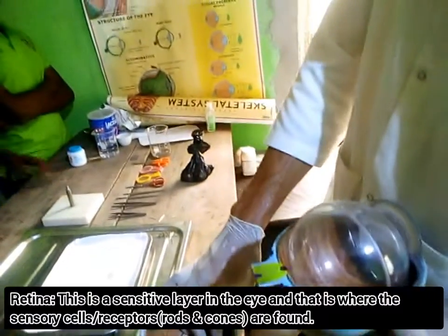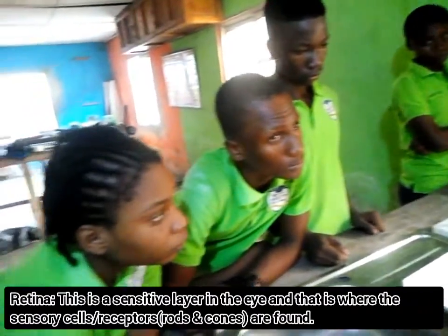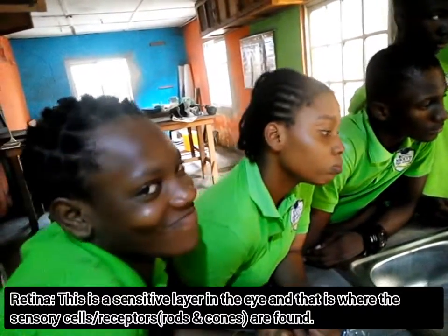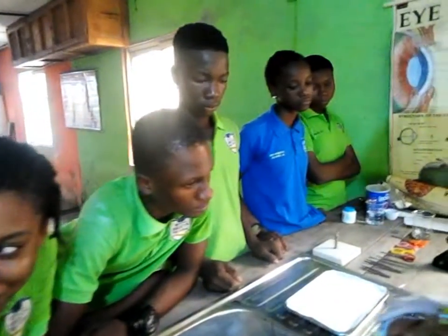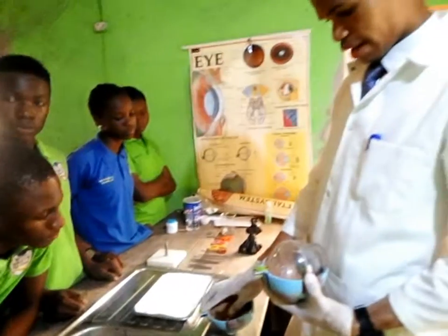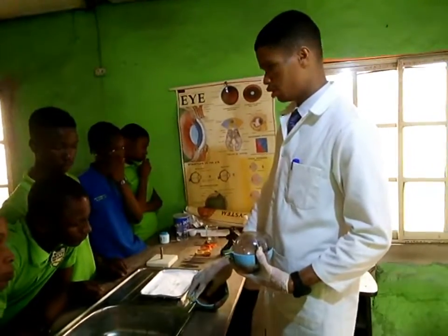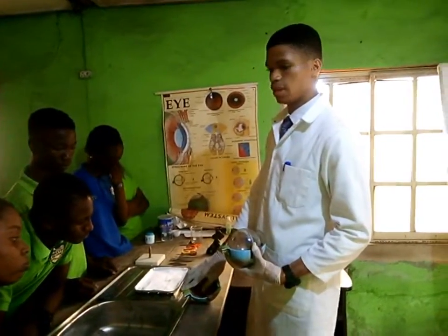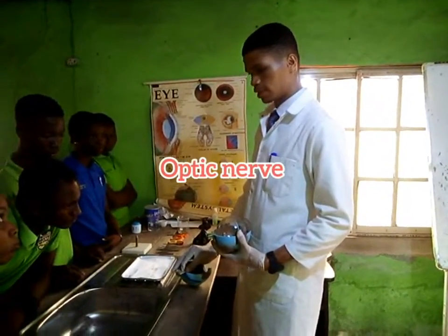And the sensory cells in the eye include the rod and the cone. Now if you look at this inner part of the eye, you see some kind of green color, although it's not really green in a normal human eye. But it's giving this color, so we are going to identify it separately. Now this is what we call the optic nerve.